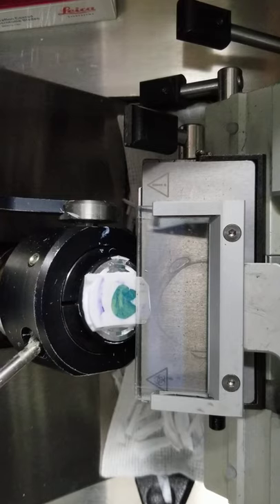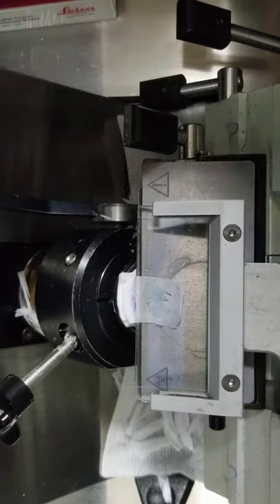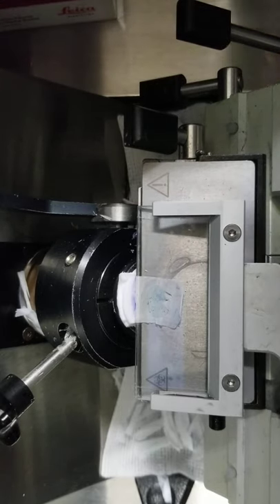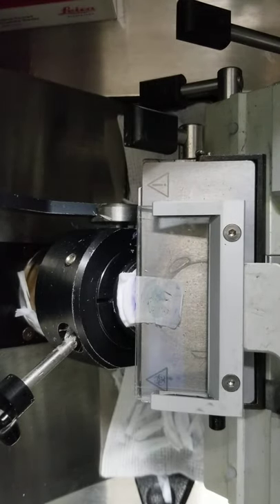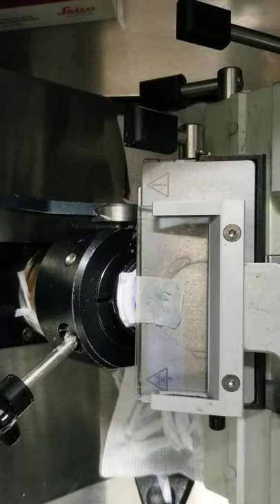And this is more like a fatty piece, so kind of get it started and then do one quick cut. You know, that's for extreme fat. Other ones you want to actually have a more slow cut. I've got another one that I'll show. It's kind of like a second layer.